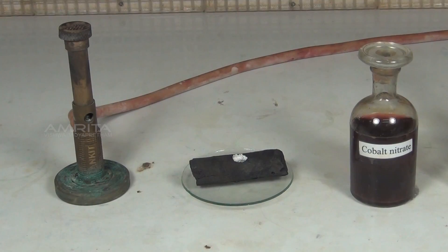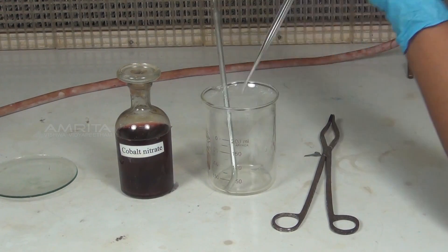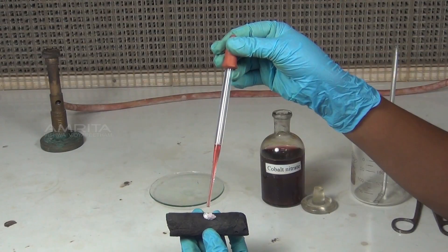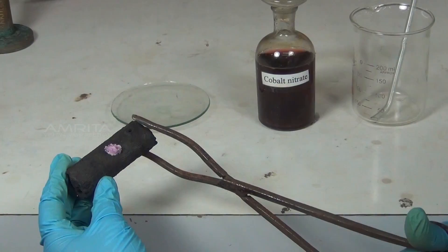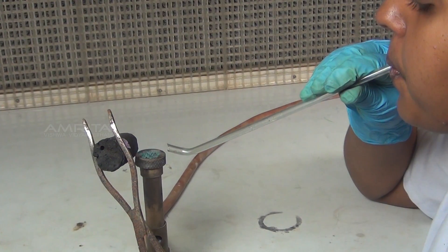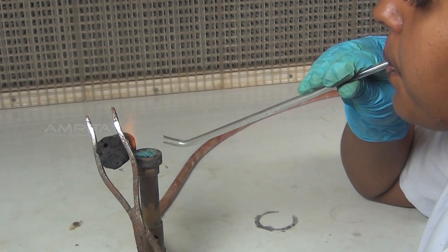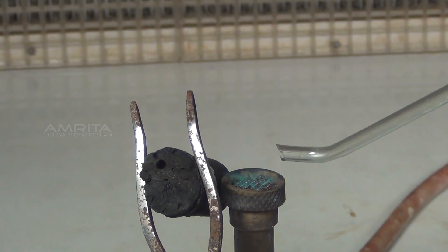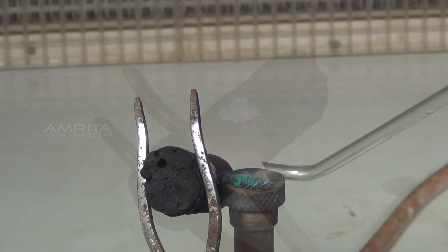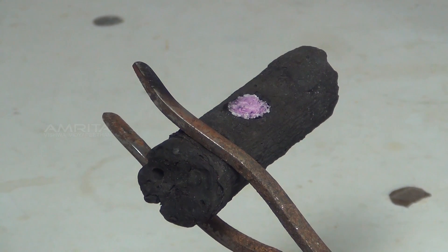Procedure: Take the charcoal piece with the white residue in it. Using a dropper, add a few drops of cobalt nitrate solution to the white residue. Using the tongs, hold the charcoal piece in front of the oxidizing flame of the Bunsen burner. Direct the oxidizing flame on the cavity by means of the blow pipe and heat strongly for some time. Formation of a pink residue indicates the presence of the magnesium ion.